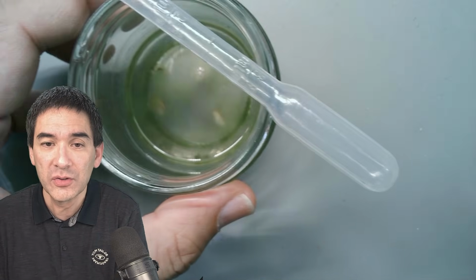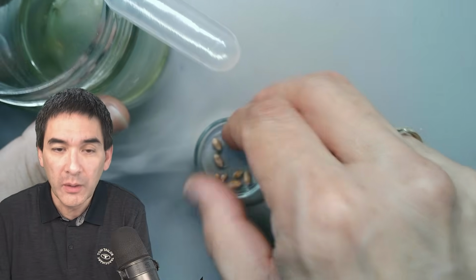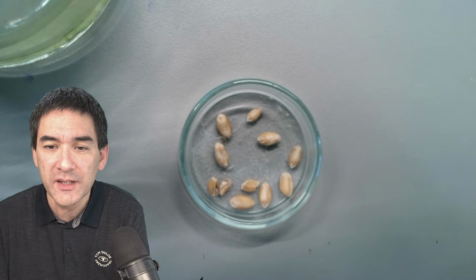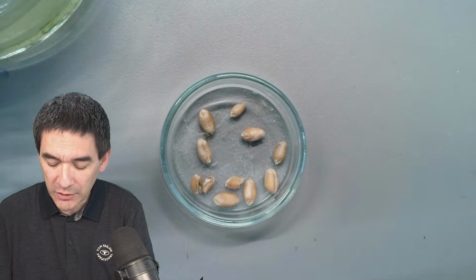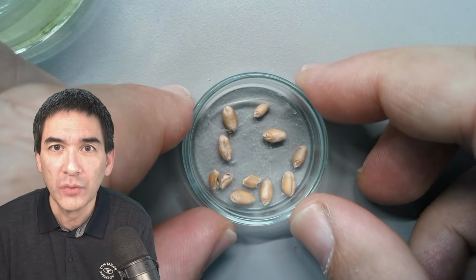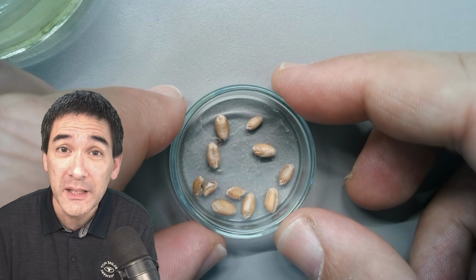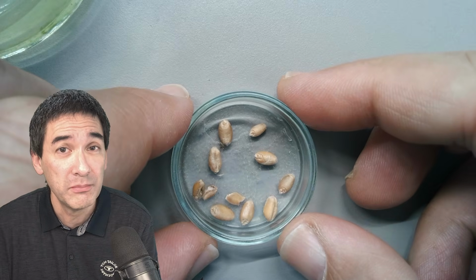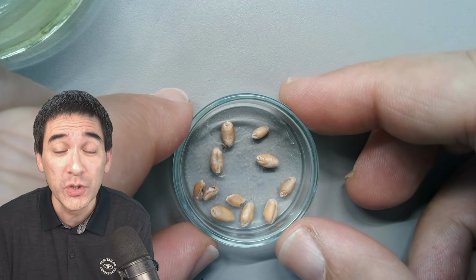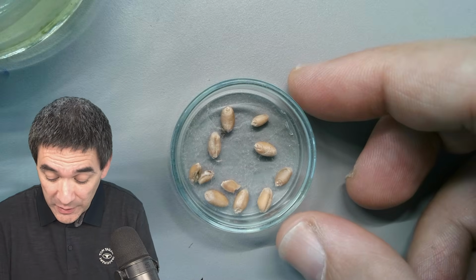We're going to get started with this sample over here, and I would like to simply show you what I have done last week. If you want to do a so-called enrichment culture, I have to focus this a bit. Here we go. Enrichment culture. This basically means you would like to grow a couple of ciliates for microscopy. The thing is that in a water sample, even though there are many microorganisms present, many of them are in fairly low concentration. So you would like to have more of them, so it's easier to observe them. And this is what I have done.